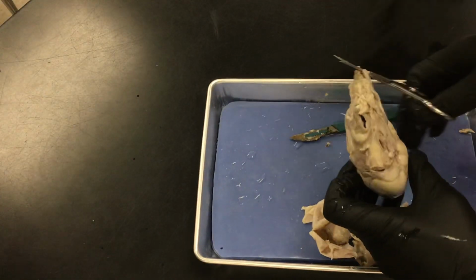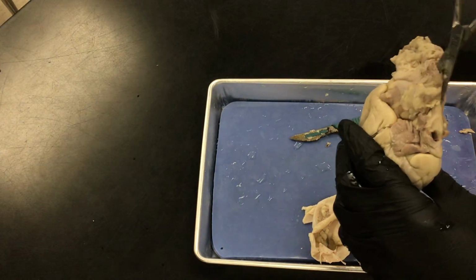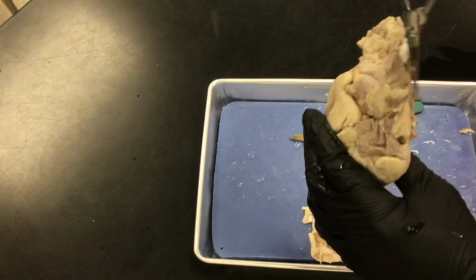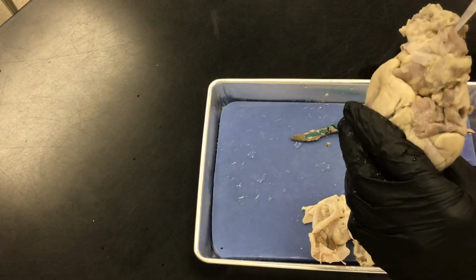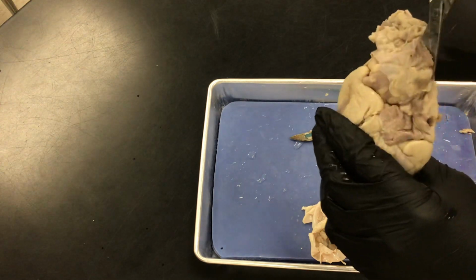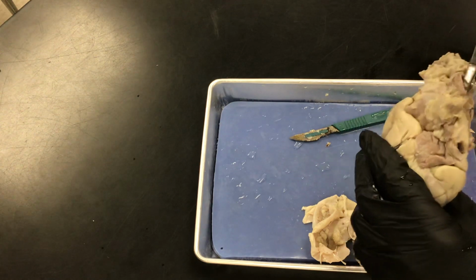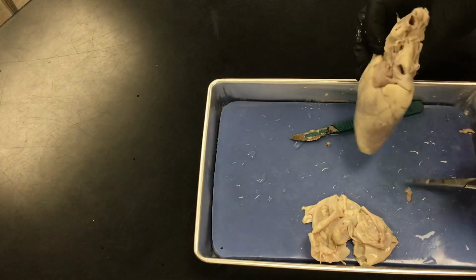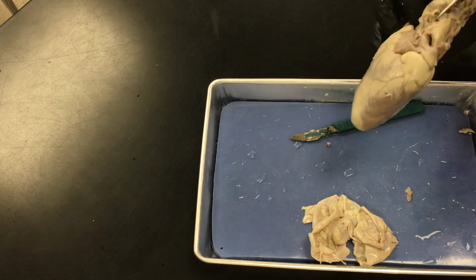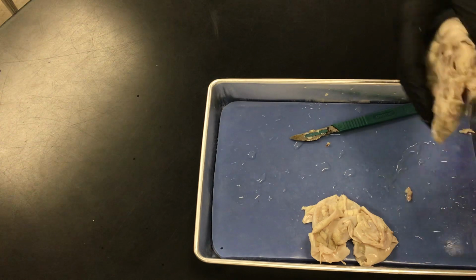So this one right here, facing you. There you go. It's okay if he cuts the other one. It actually won't matter. Look at what you're doing. Let's see. That part can be tough. Let me help you out with this part. You actually have a tough vena cava on this one.